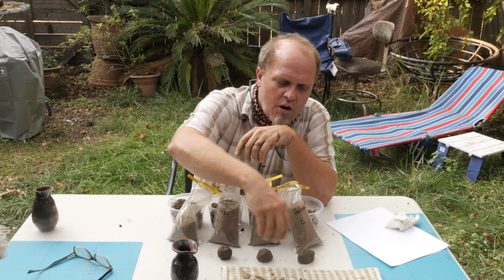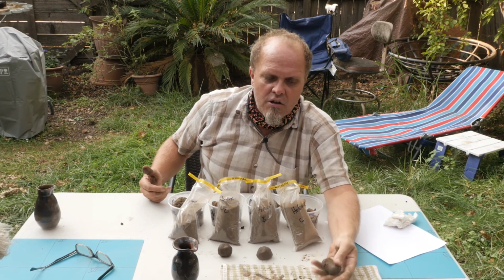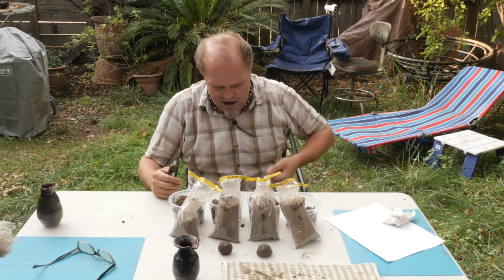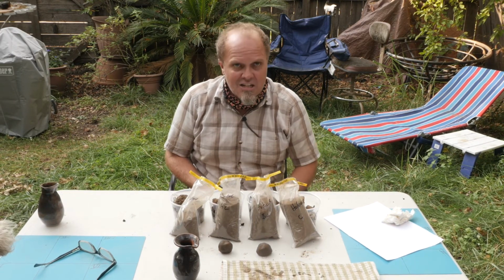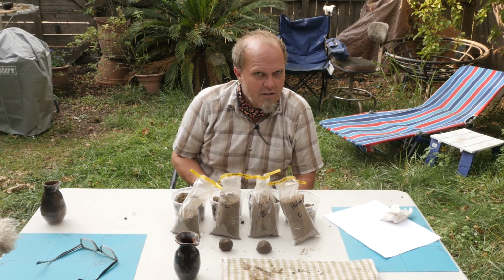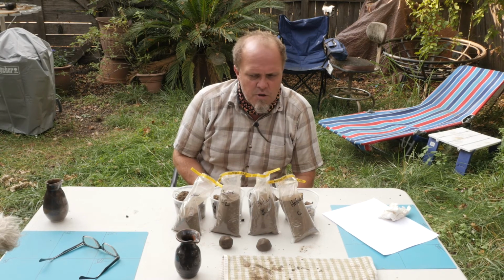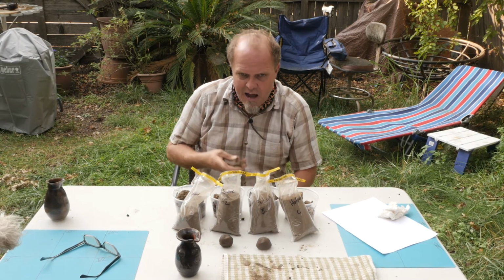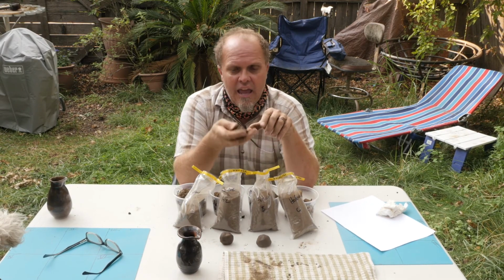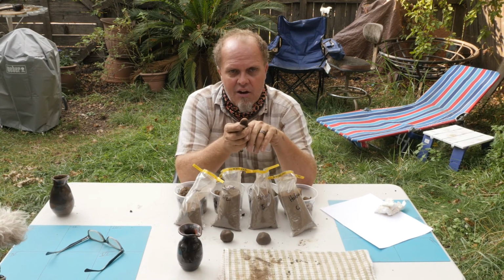We can continue to work our way down. The one thing that you would find is at the bottom that this one really does lose its clay content. And actually, if we were to get the sound of this on the microphone, you can actually hear the sand as you crush it in your hand. And this is where some of these things cross over. It's not just about the tactile nature. It's about listening, looking, and feeling, and understanding where those breakpoints on that diagram lie.